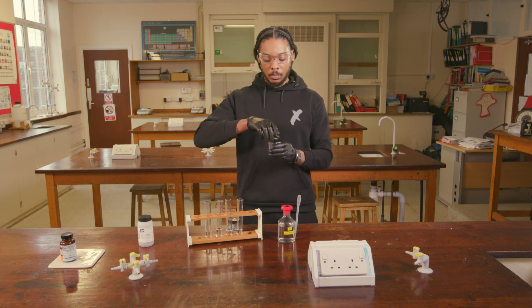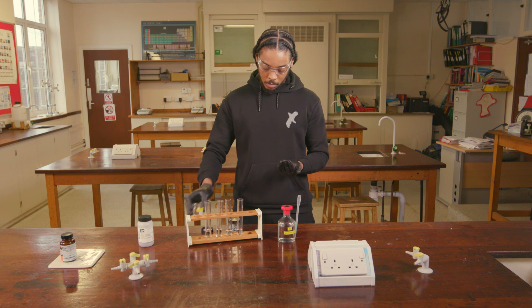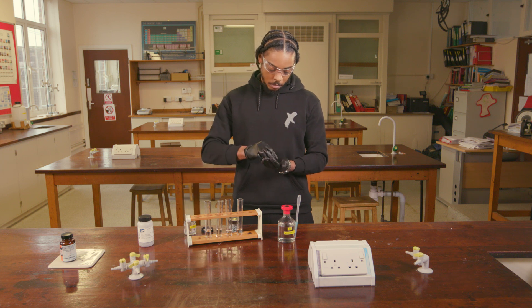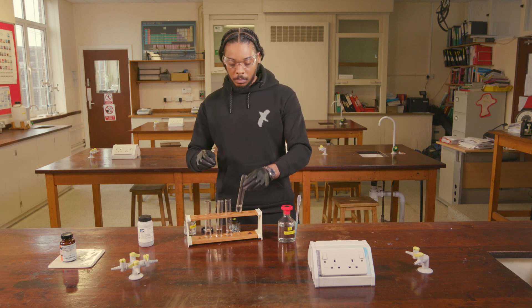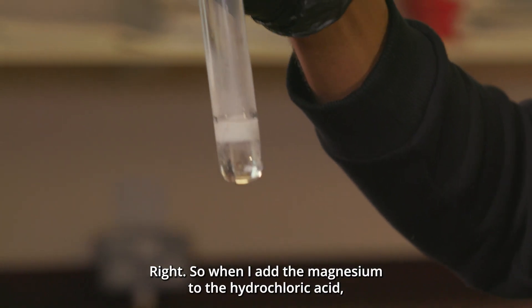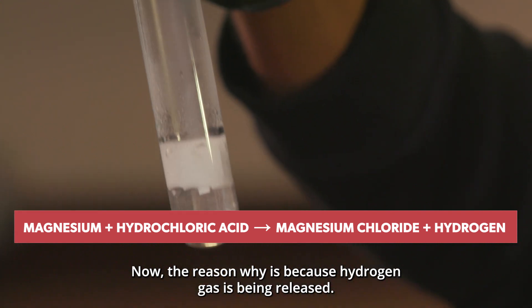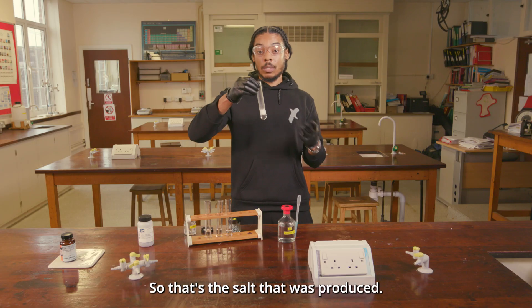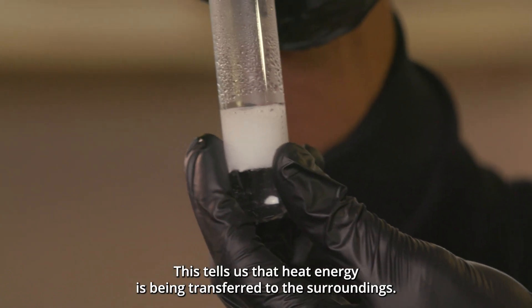We're going to put the magnesium into the hydrochloric acid. When I add the magnesium, we can see a lot of effervescence and bubbles being produced — that's because hydrogen gas is being released. The magnesium is reacting with the chlorine in hydrochloric acid to produce magnesium chloride, which is the salt produced. If I feel the boiling tube, it's actually starting to get warm, which tells us that heat energy is being transferred to the surroundings.